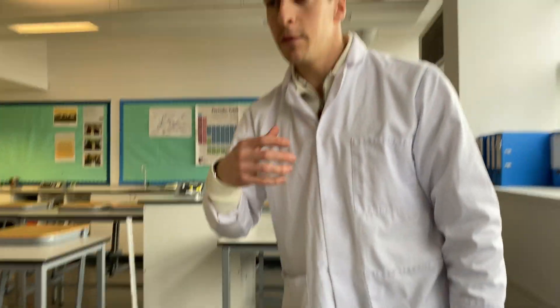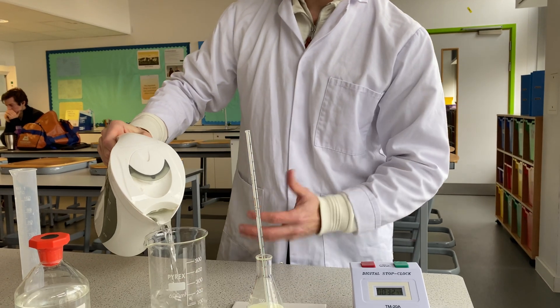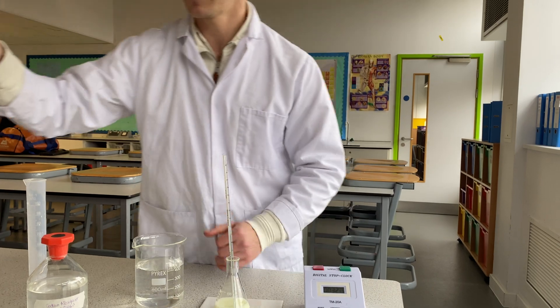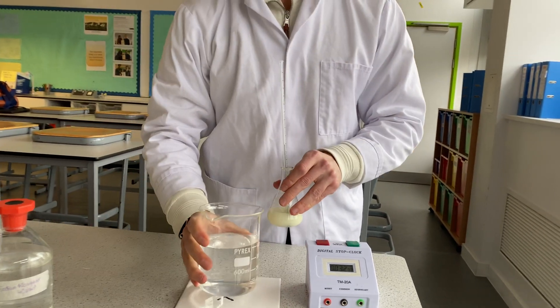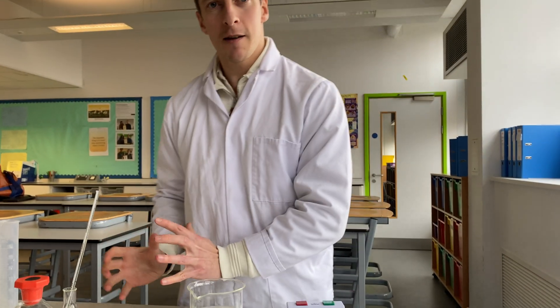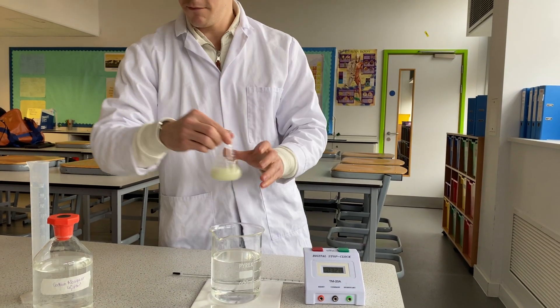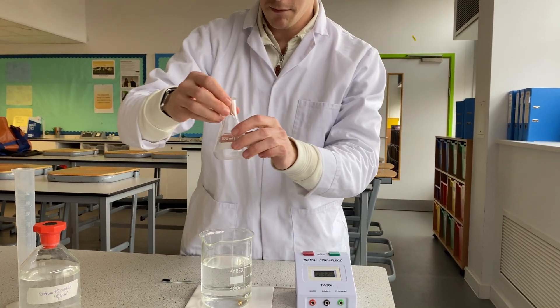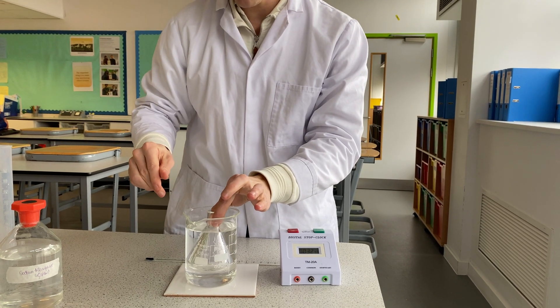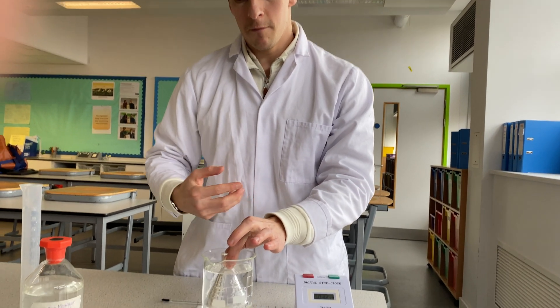To change the temperature, we repeat the exact same procedure, but we use hot water from the kettle to make a water bath in a large beaker. We don't heat it on a stove — we use a water bath instead. We place the conical flask into the water bath, add the sodium thiosulfate, measure the temperature, add the hydrochloric acid, and start timing.